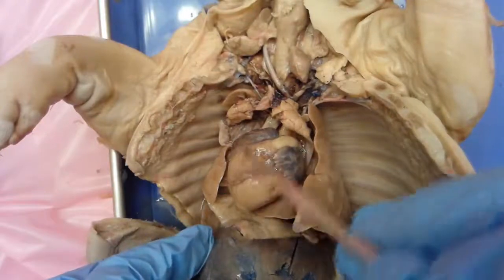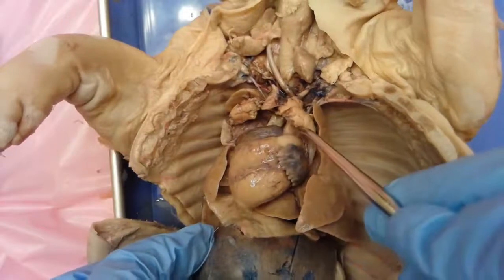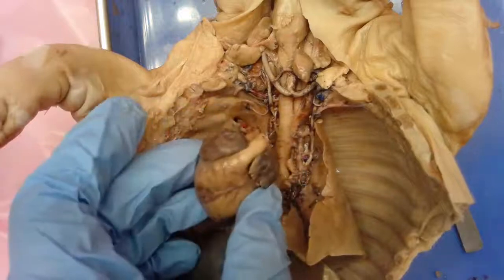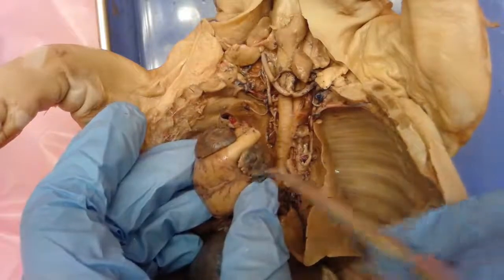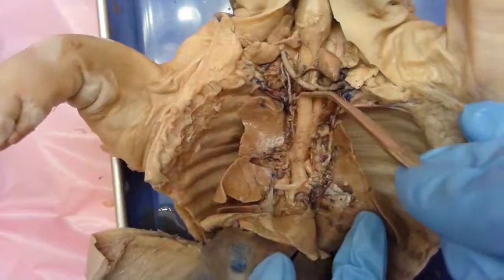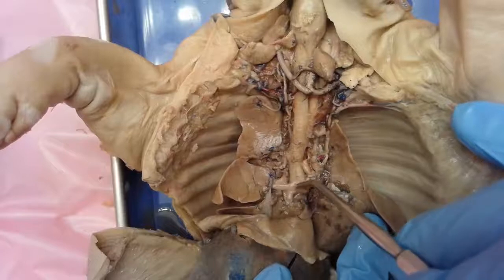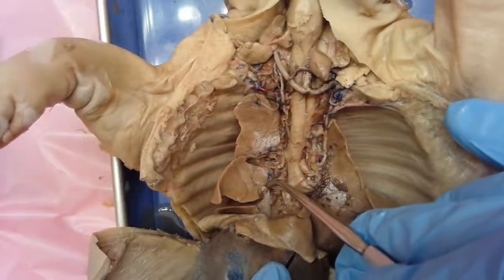That's our circulatory system. I'm going to pause for a moment and actually remove the heart and cut it open so that you're able to see what it looks like internally as well. I went ahead and removed the heart and cut all the blood vessels that were connected to it that we talked about. Before I point out some of the structures and let you see what things look like internally, I wanted to show you what was going on behind the heart now that it was out of the way. Here you can see the full trachea — it started up here with the larynx, that bulge there, and then it came all the way down. You can see the branches that are going into those different lobes of the lungs — those bronchi that will eventually branch down into smaller bronchial tubes.